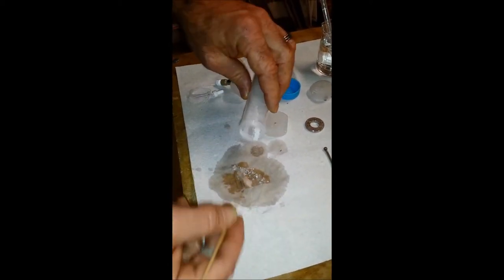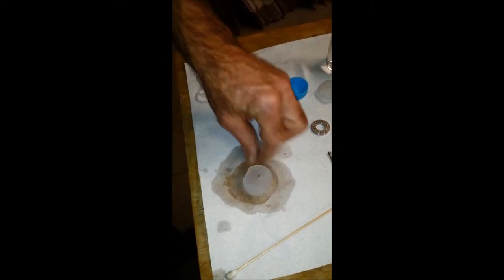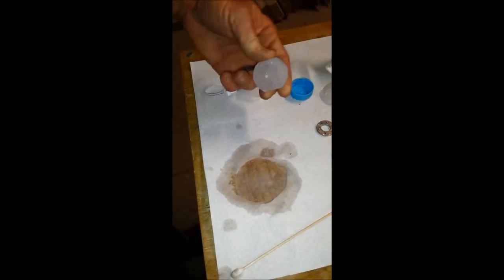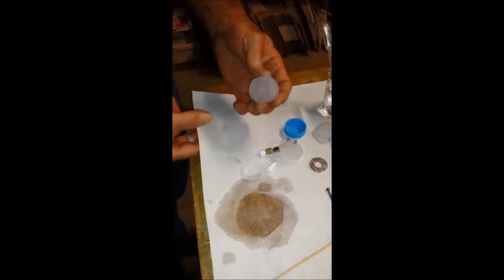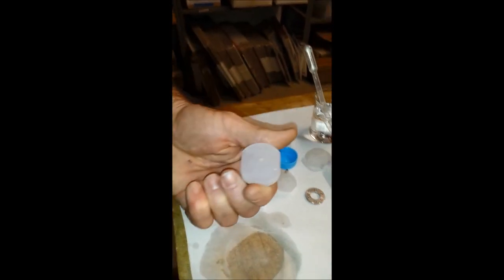polishing compound, a scientific grade, and in a circular motion polish the whole surface. This is probably the best way to do it because you're not going to put any grooves into it. And then when you're finished, you want to make sure you dry everything off very carefully and reassemble the flow cell.